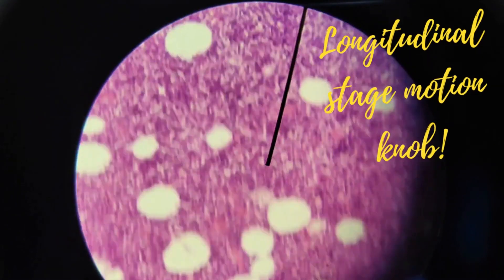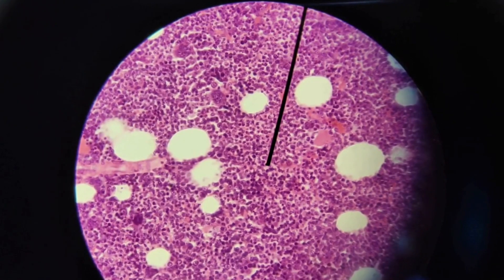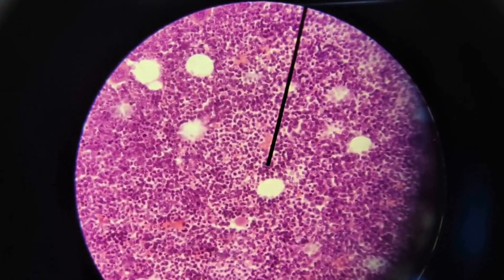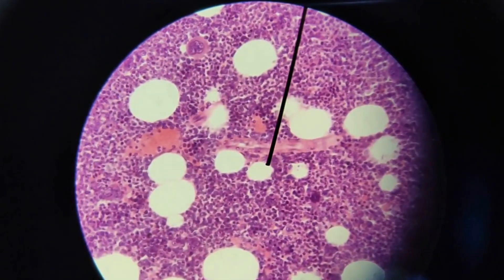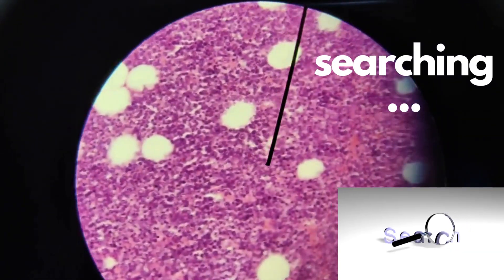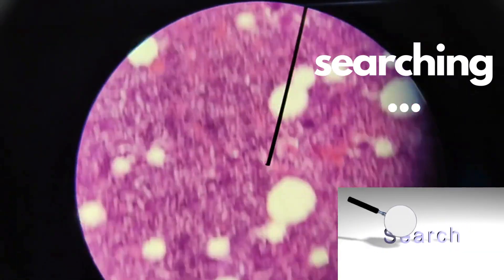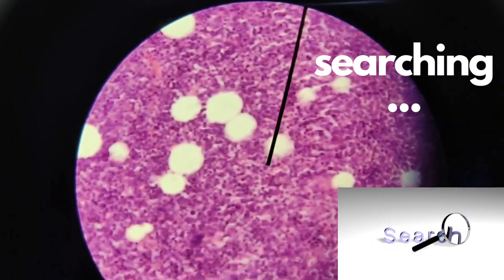You can go up or down, left to right, or right to left to search what you need to check on this histological slide.